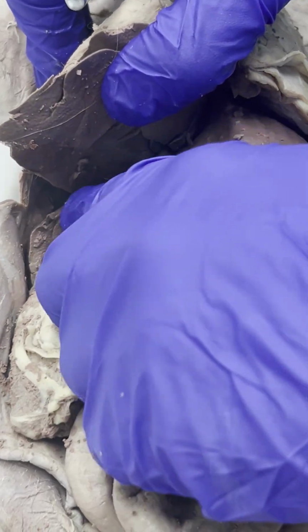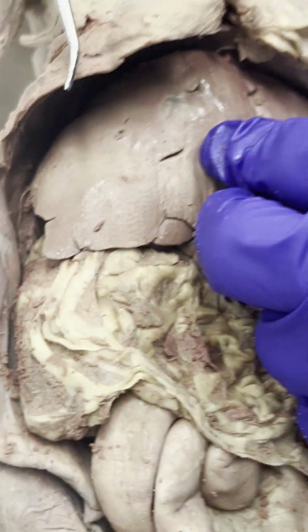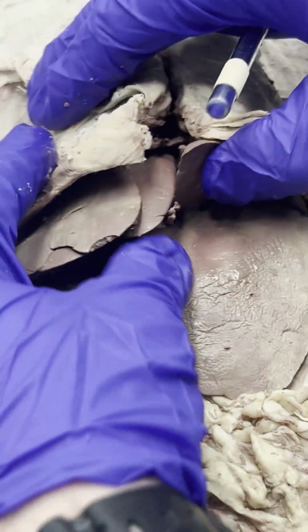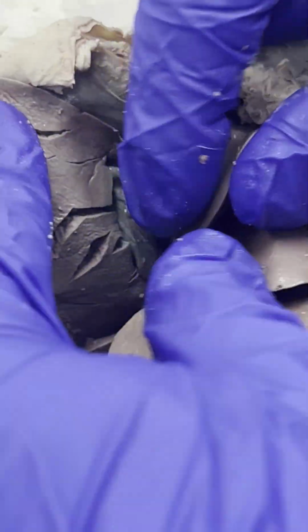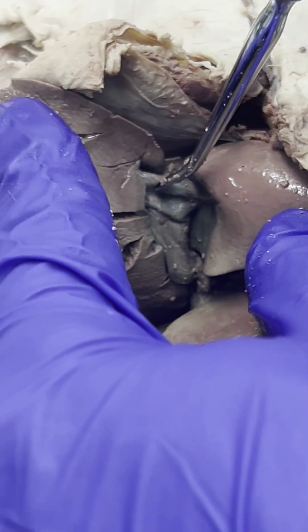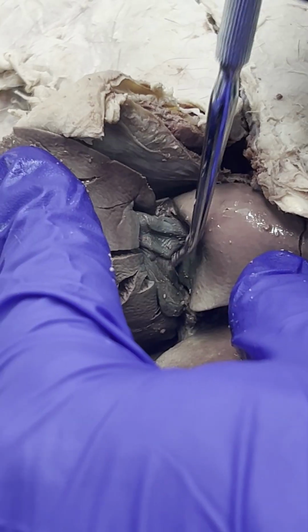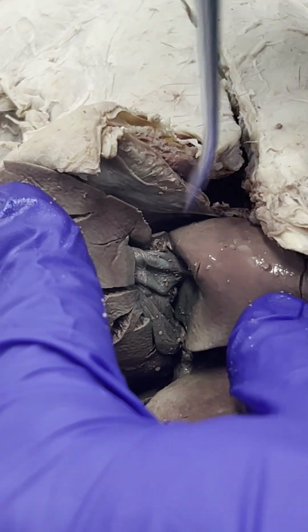So the cat has 6 different parts of the liver, 1 liver in total, but keep in mind there's 2 hiding under the right medial, which is right here. Okay? Because we're talking about the liver, let's find the gallbladder. So the gallbladder in this specimen too is going to be green, a lot larger than the sharks', as you can imagine. So here is your gallbladder. And of course, you guys know the comment that I'm going to make: make sure you know what the function of the gallbladder is.